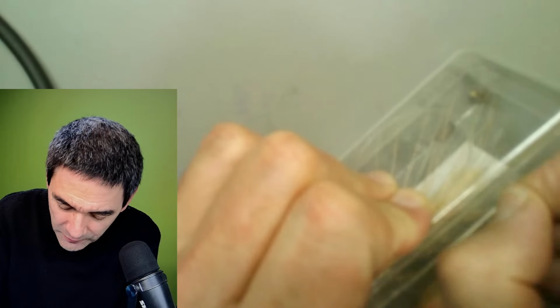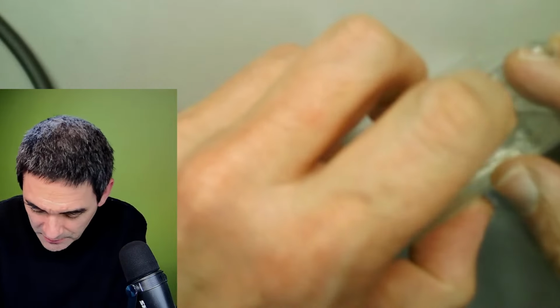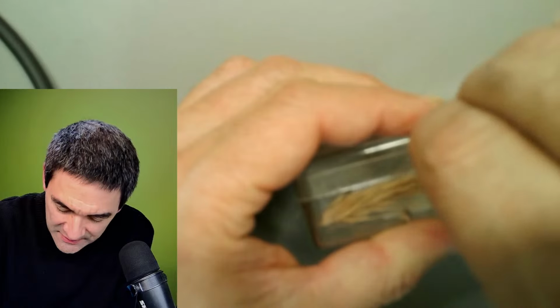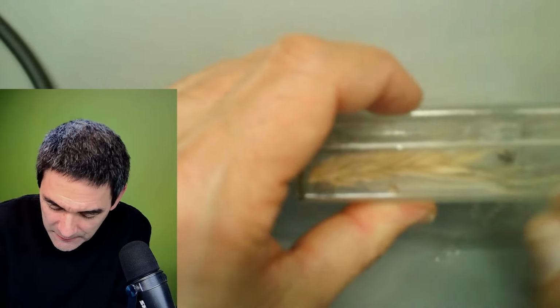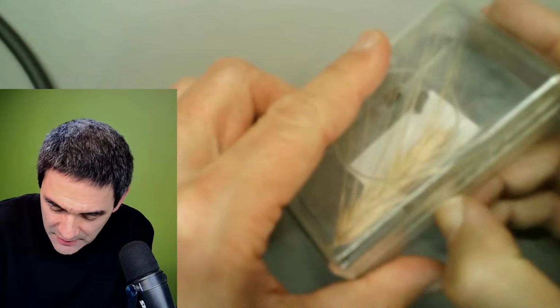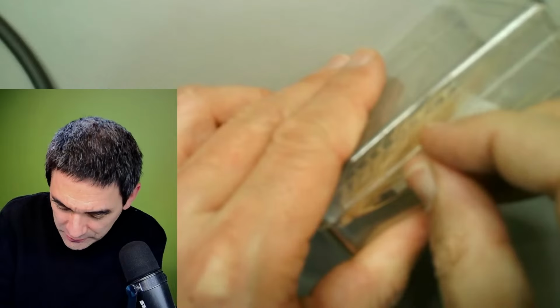This stuff, what I have here, killed a lot of people in the past. Nowadays not a problem because we now know what the problem is. But maybe you've heard of so-called St. Anthony's fire before. Not St. Elmo's fire, but St. Anthony's fire. This is, in German, called Mutterkorn. In English, it's called Ergot.